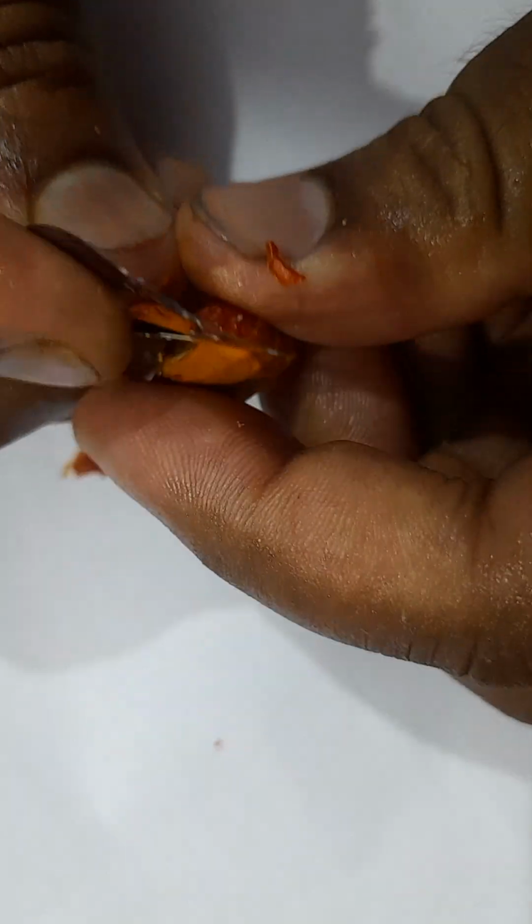If I can show you the stony part, you see the fleshy part I am removing, and then after removal of the fleshy part. This is the micropylar region, and I am removing the fleshy parts. Can you see it? Yes. And see, the stony part is coming now. Can you see the middle portion? Yes.